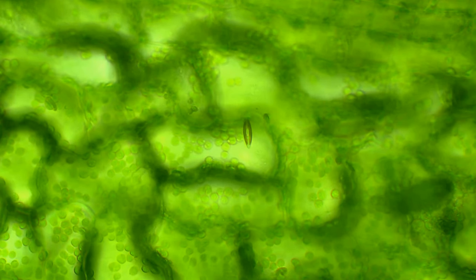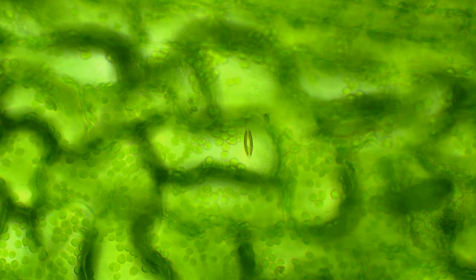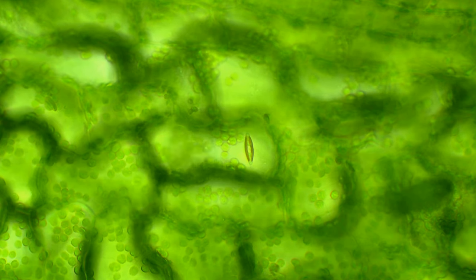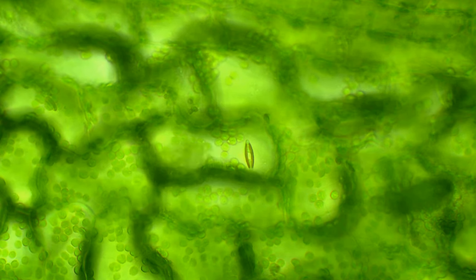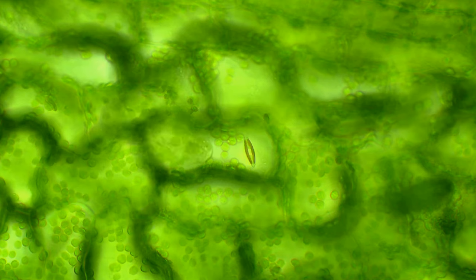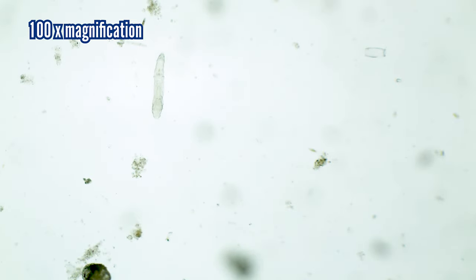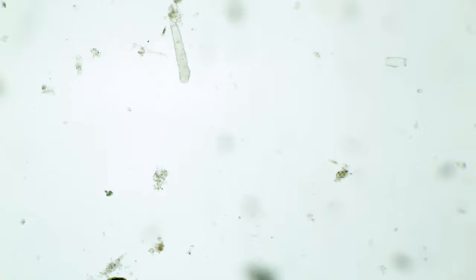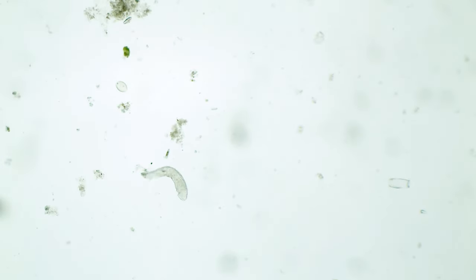And here we can see the first moving inhabitant — the scene reminds me of the Pac-Man game, of course the pre-release version. I really hope that the water I squeezed out of the filter is alive... and it definitely is! Here is the first micro inhabitant — it's probably some kind of flatworm, but I'm not entirely sure because it moves a bit like a leech with suckers at the end of its body.